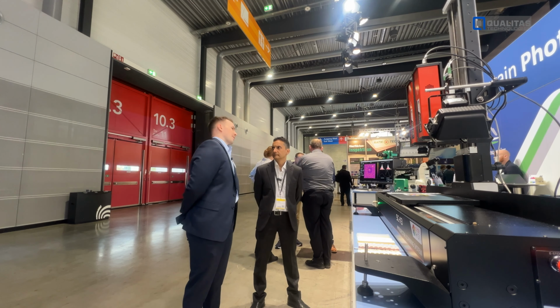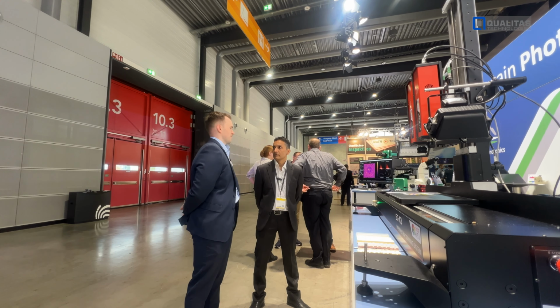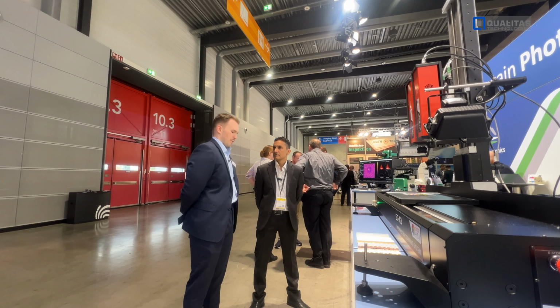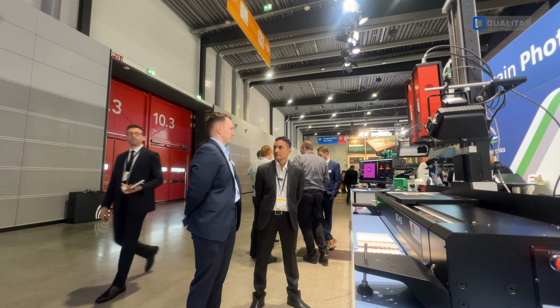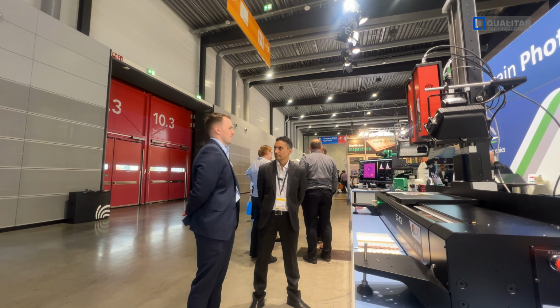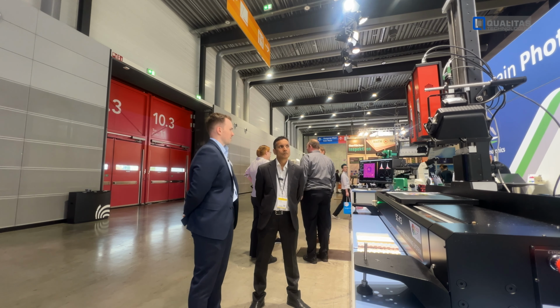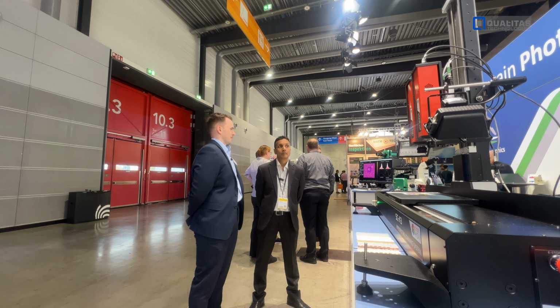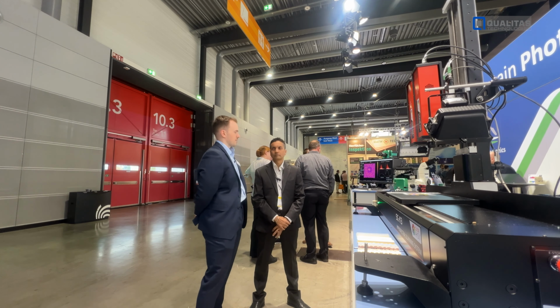In the visible, going in the other direction, you can do very accurate color differentiation. The human eye can typically detect a delta E, the difference in color of two shades, of 1 to 2 delta E. With a visible hyperspectral camera, it's typically 0.1 to 0.2, so a 10 times more sensitive measurement. And the reason for that is super high spectral resolution.